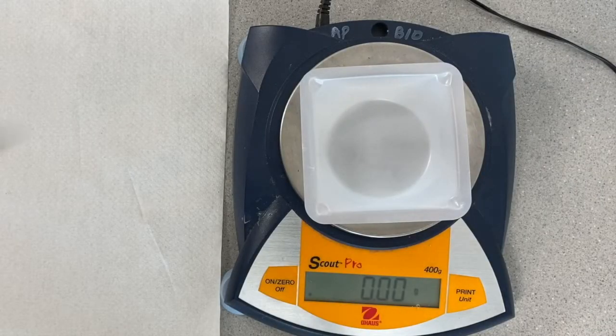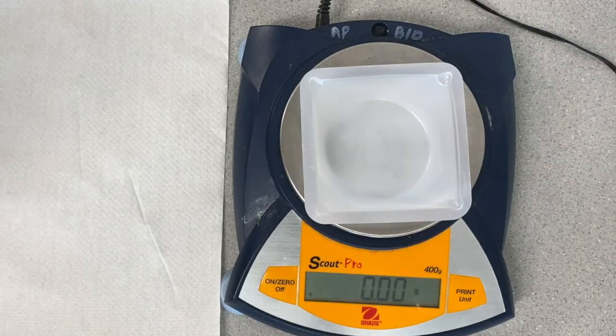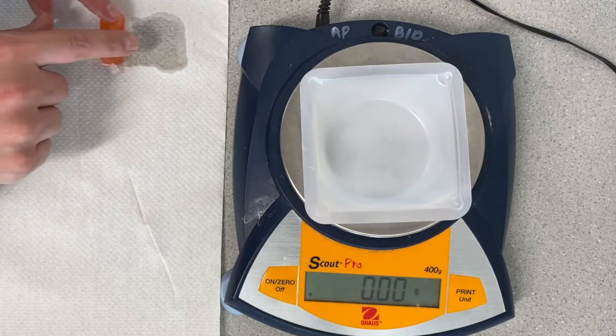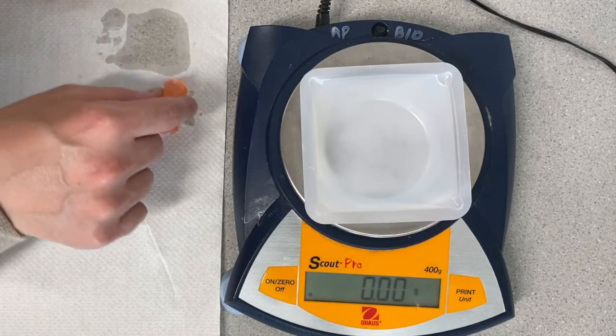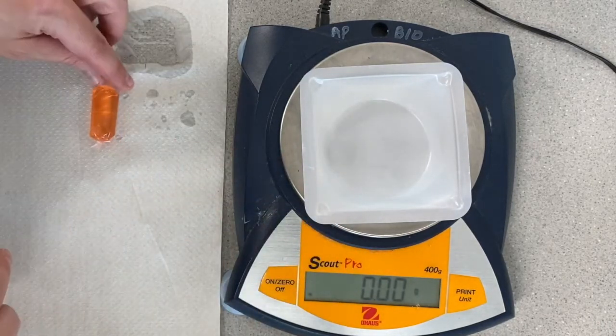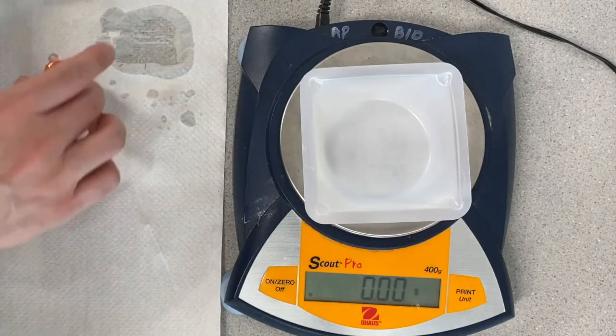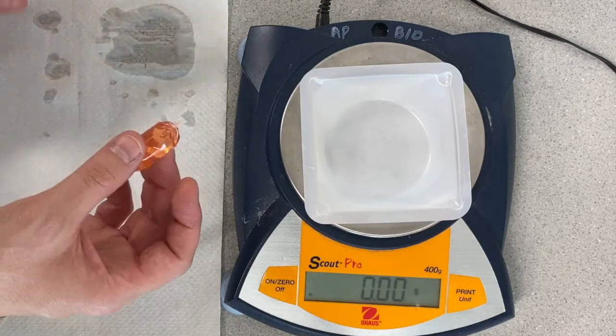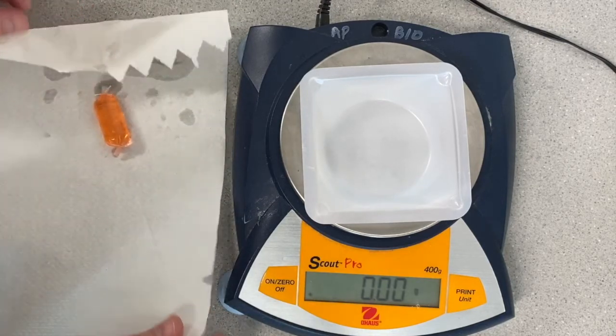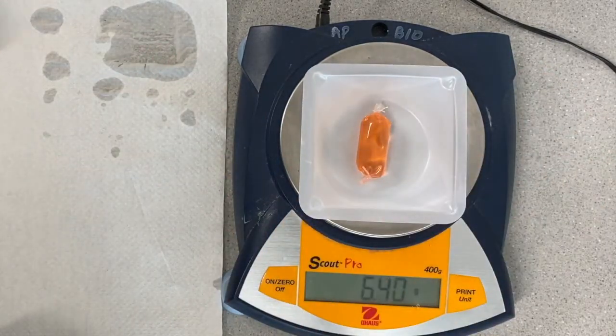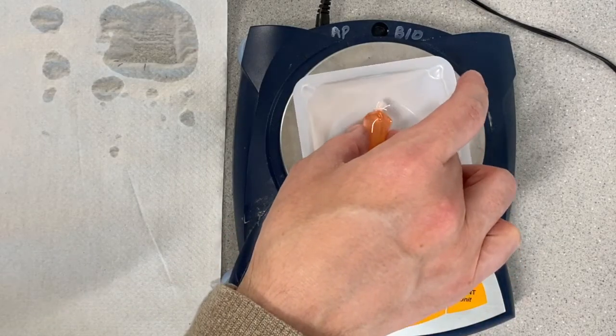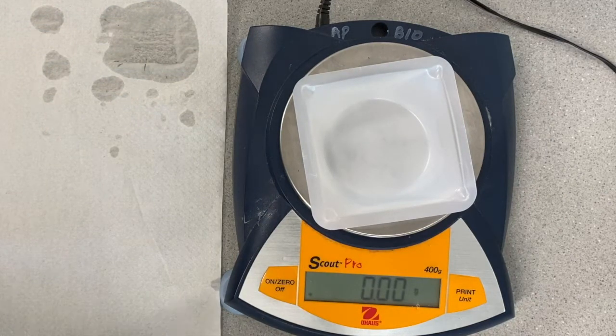The last piece of data I'm going to need to record is a final mass for each one of my cells. I'm going to start by taking out the glucose cell from its environment, and I'm going to start by drying it off because I don't want to include the mass of any of that water on the outside in my final mass for this cell. Just like I did before, I already zeroed out my balance, so it's ignoring the weight of the weighing boat. And once I've dried off my cell, and especially you want to make sure that you dry off the ends of it because they tend to grab a little water and hold it inside of those little ends. You can kind of press down the paper towel to get the water out of those ends. Then I'm going to put it back in here and take a final reading. And I can compare this to the reading that I took at the beginning of class today. So now I am done with my glucose cell, and I can dispose of everything that's in that cell into a trash can.